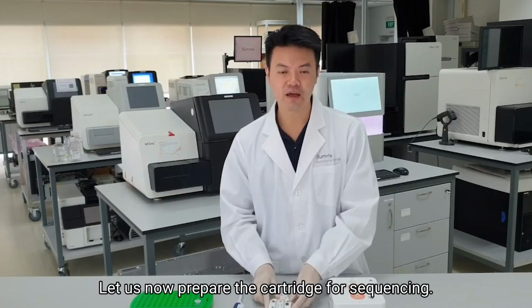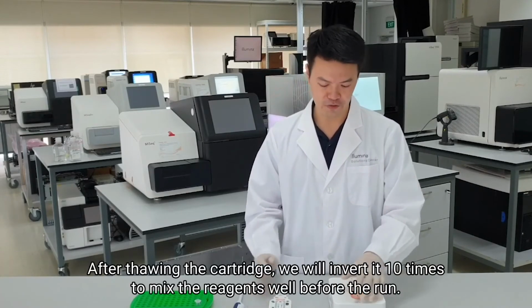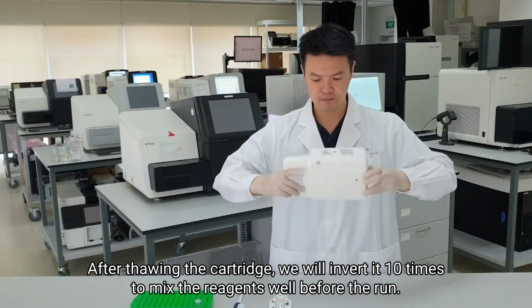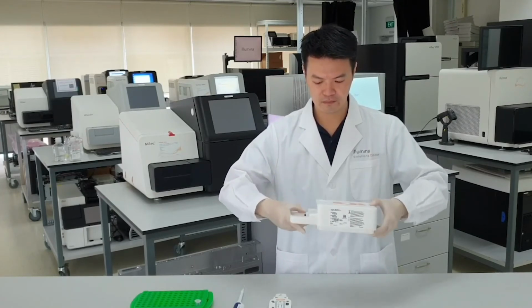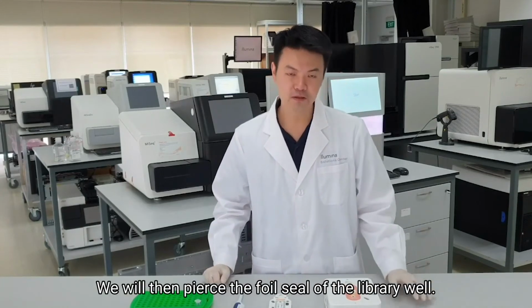Let us now prepare the cartridge for sequencing. After thawing the cartridge, we will invert it 10 times to mix the reagents well before the run. We will then pierce the foil seal of the library well.